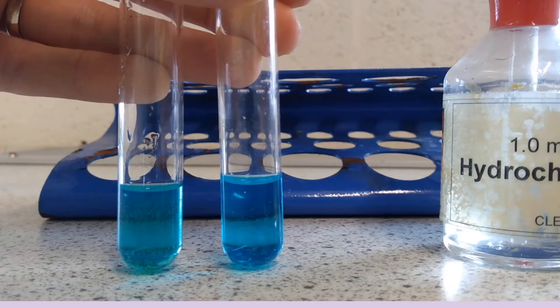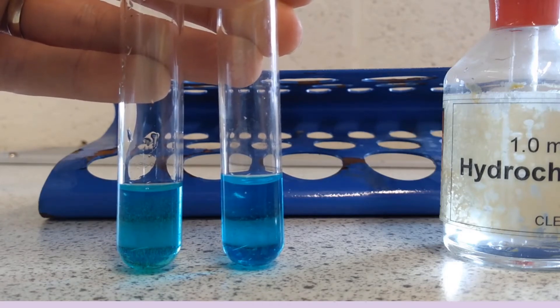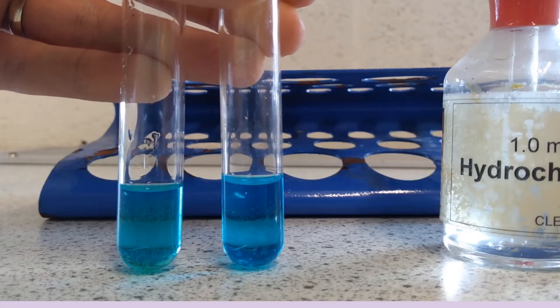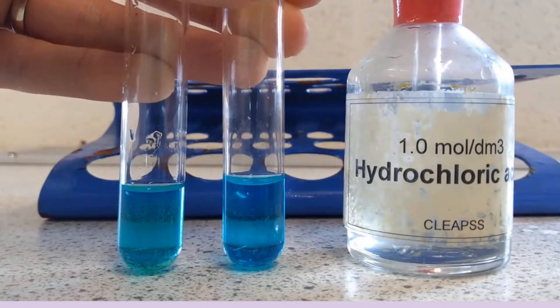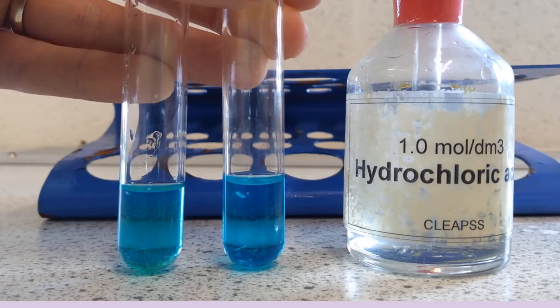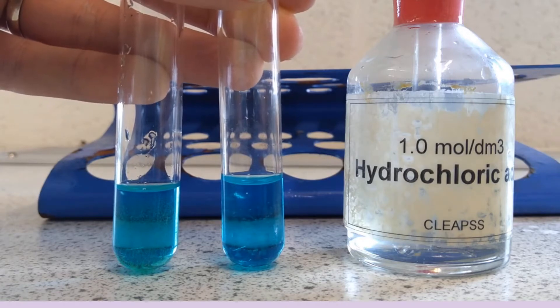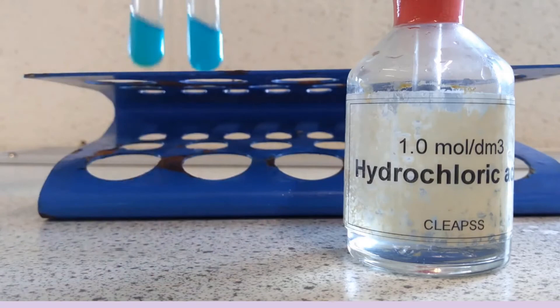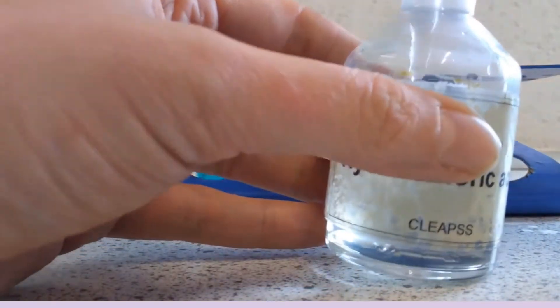For the sulfate test I've got two test tubes here each containing a blue copper-based compound and I'm going to test these to see which one contains sulfate ions. Firstly I have some hydrochloric acid — the purpose of the acid is to remove other anions which would give me a false positive test. Lots of acids would work but crucially I can't use sulfuric acid because that would introduce sulfate ions into my test. So to start with I'm going to add a little bit of hydrochloric acid to each tube.